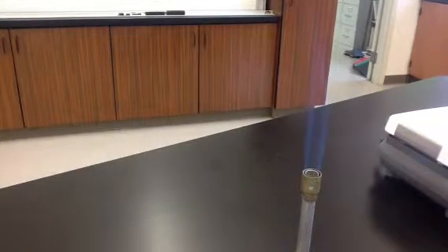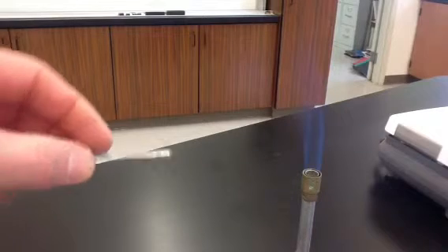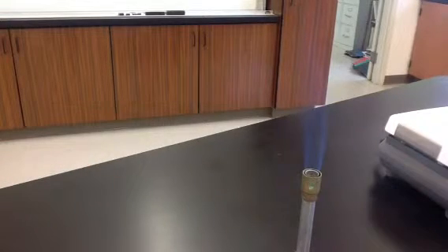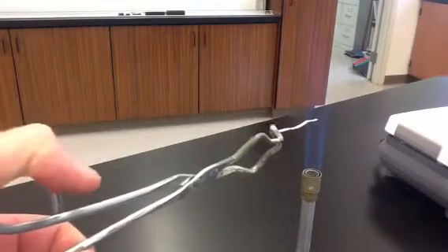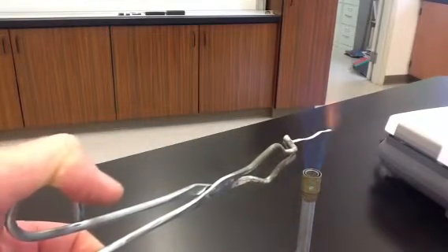Okay, so we've got a Bunsen burner. And now we're going to take a piece of magnesium metal. Here's a piece of magnesium metal. And we're going to hold that magnesium metal in the flame of the Bunsen burner until it ignites. I'm going to use tongs to do this. So we'll hold it in the Bunsen burner flame until it ignites. And then we'll watch it burn.